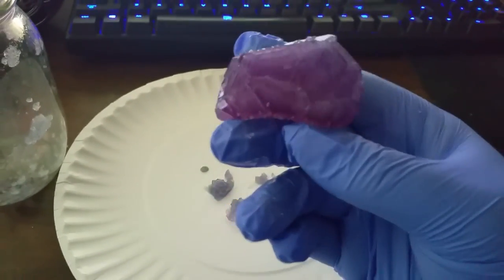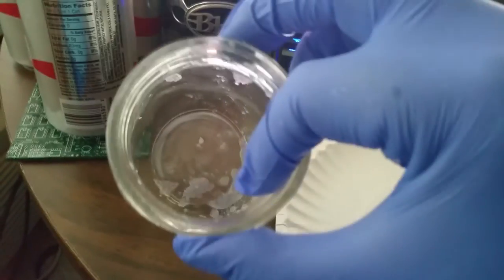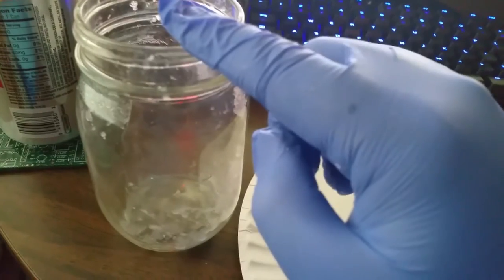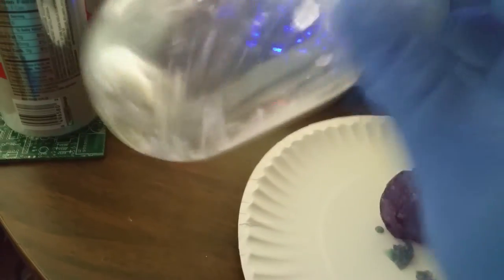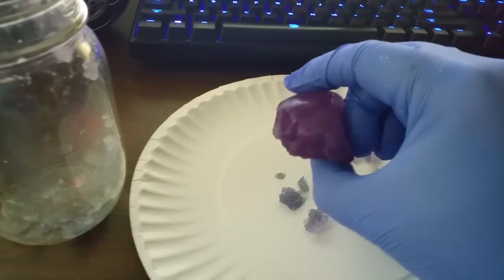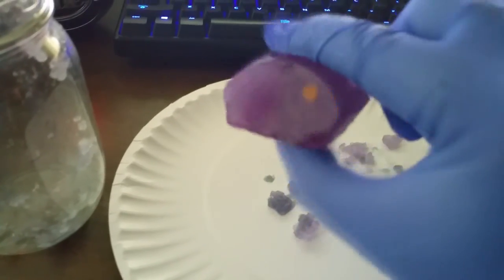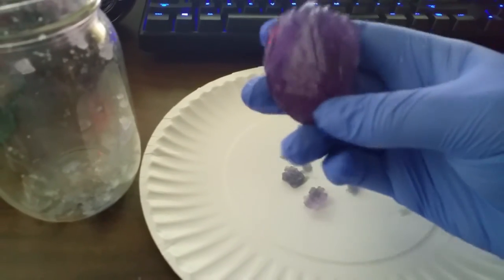It is very important you wear gloves at this time. What I've done is dump out the crystalline mass onto a paper plate and I'm simply desiccating the surface with a paper towel. Because this crystal is water soluble it will react with water in the air, so once you desiccate it, it is a race against time to protect the coating and ensure that no further destruction happens to the surface.